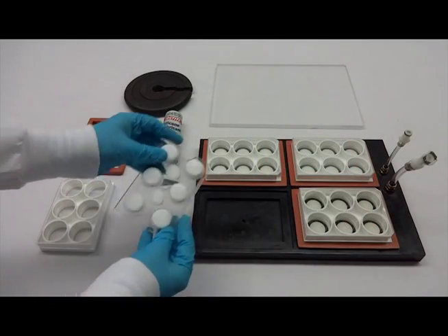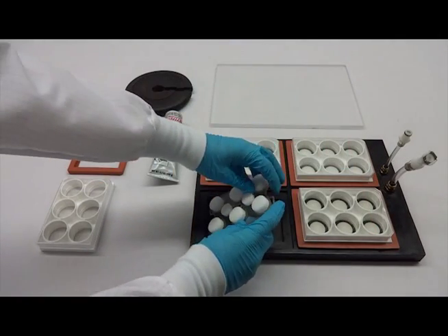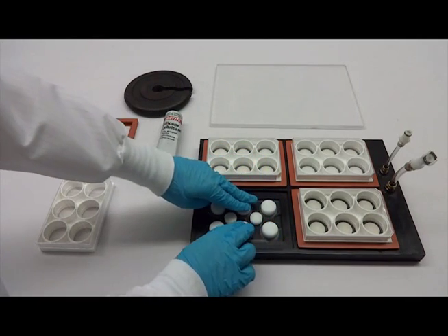First, place your loading stations into the base plate, pressing down gently to ensure proper placement.